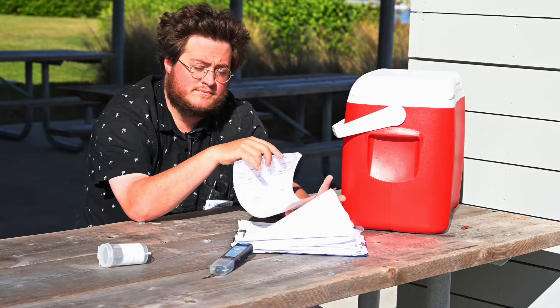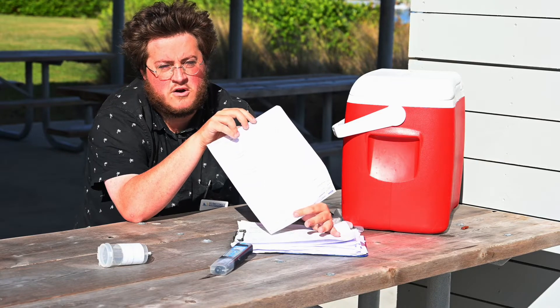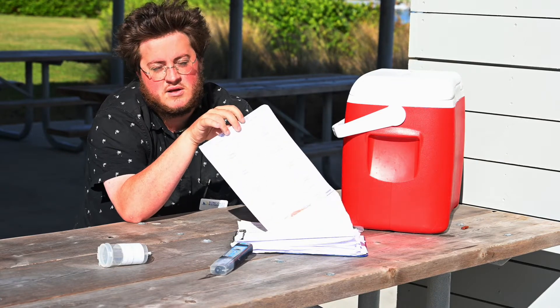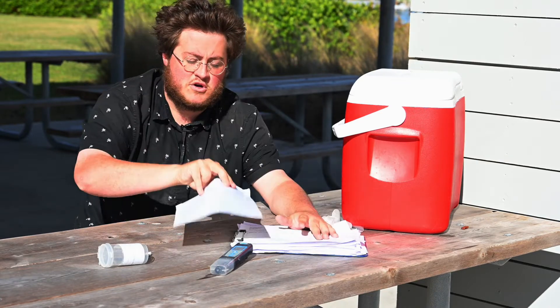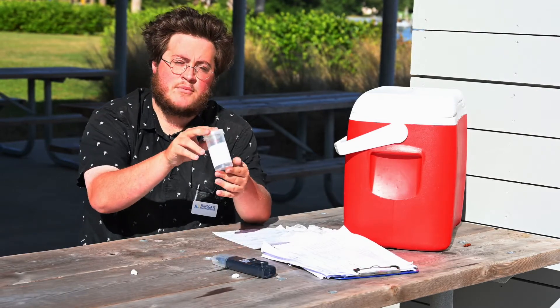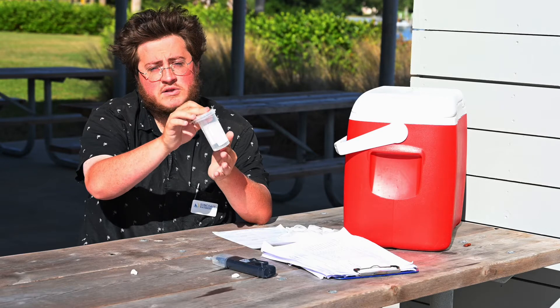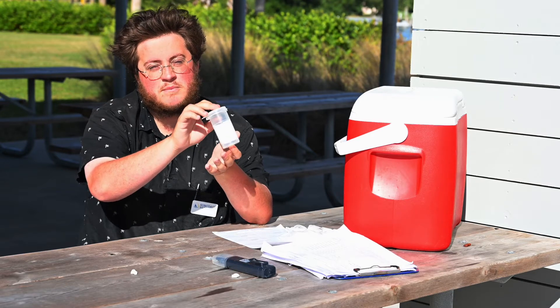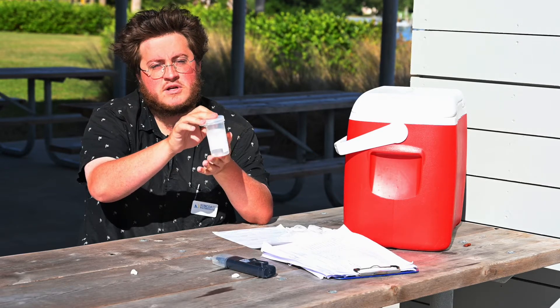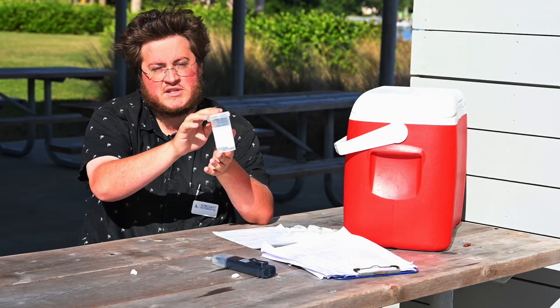Next, you have your label sheet that will go on the bottle. You're going to want to use an indelible marker to mark these because normal pens won't work when they're submerged underwater. Your salinity meter is used to measure the salinity of the water. And your sampling bottle, which has a thiosulfate preservative tablet in it — it's quite small and is necessary in order to maintain the accuracy of the sample. So be sure when collecting the sample that the tablet remains in the bottle.